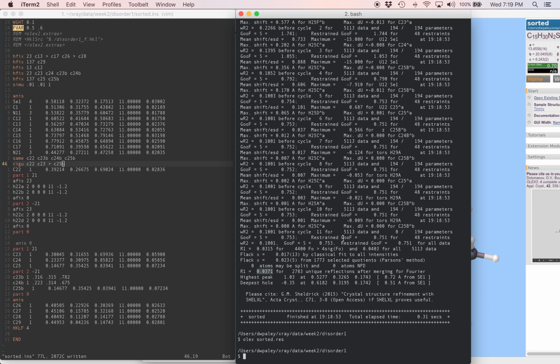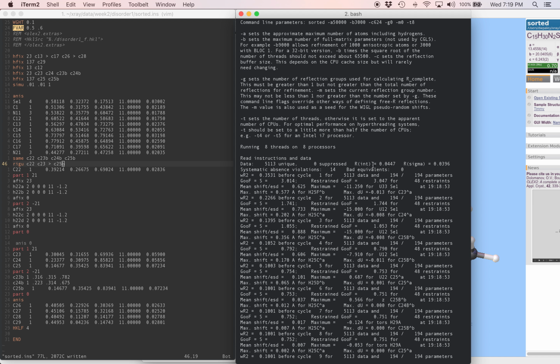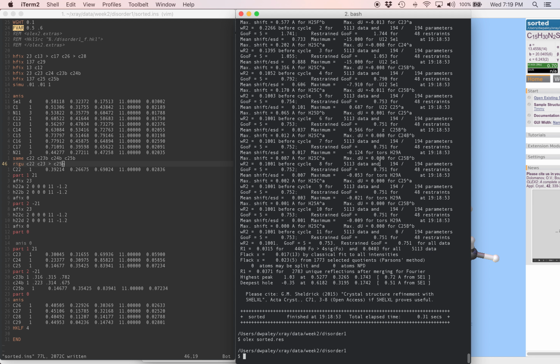R1 is 3.7%, and remember we're going to compare that to R int and R sigma up here. These are 4.5, 3.9%. So actually R1 is the smallest number, and that's great. A highest peak of 1.0 electron, that's a little bigger than we would like to see, but it's not such a big deal. And again, the fact that it's near selenium, it's easy for artifacts to show up there, and it doesn't have to mean anything bad.